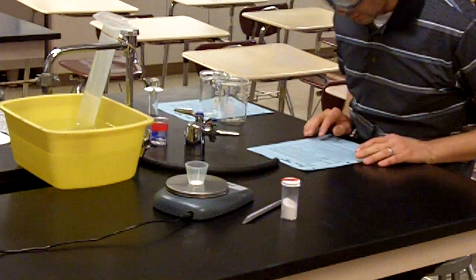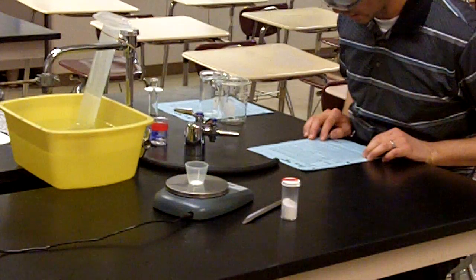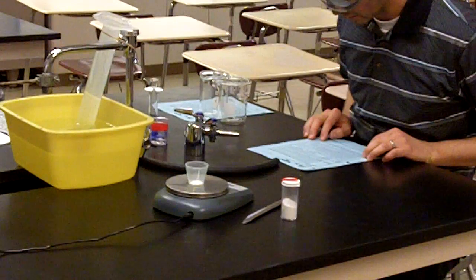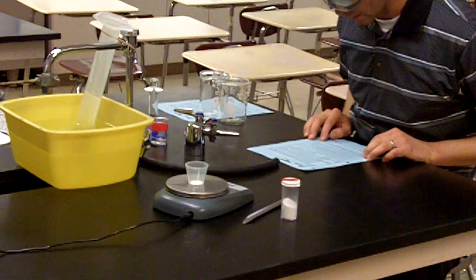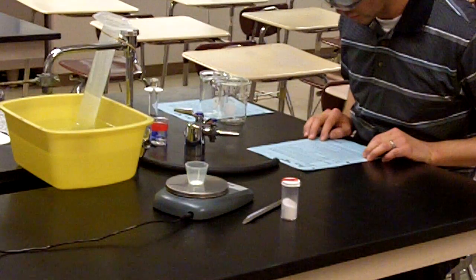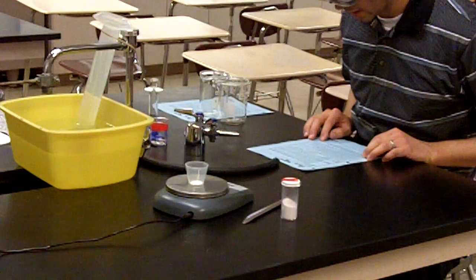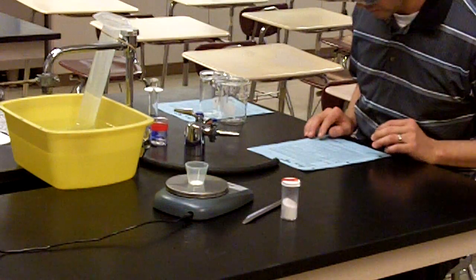reaction. The background paragraph reads: in today's activity, using water displacement and the capture of an evolved gas, you will make use of the combined gas law and calculate the theoretical volume of gas expected against the actual volume of gas produced. From this data, you will then calculate a percent error between the two volumes of gas. While doing this activity, look for possible design errors to explain any differences between these numbers.